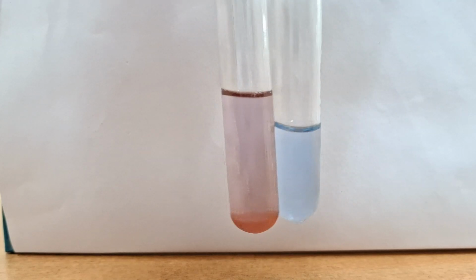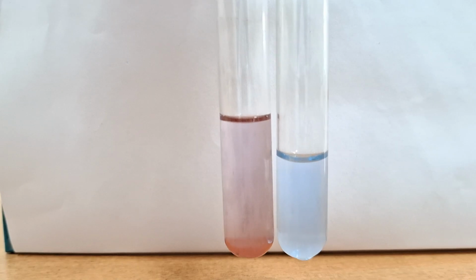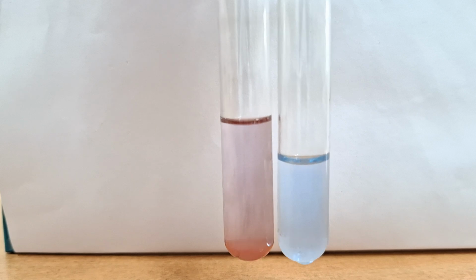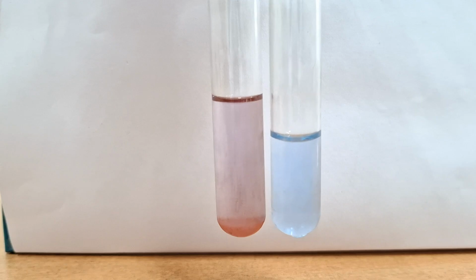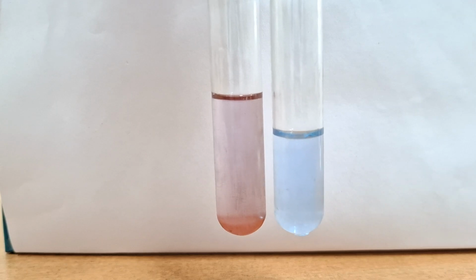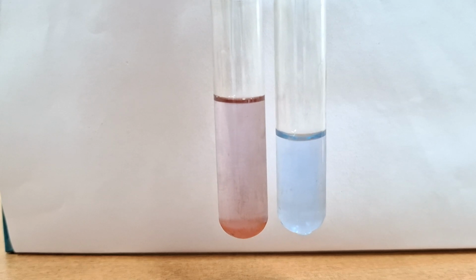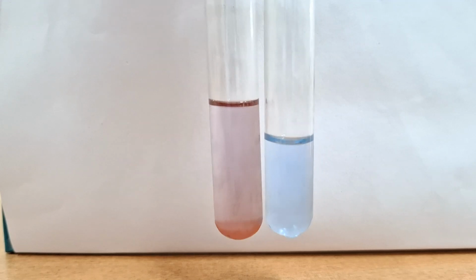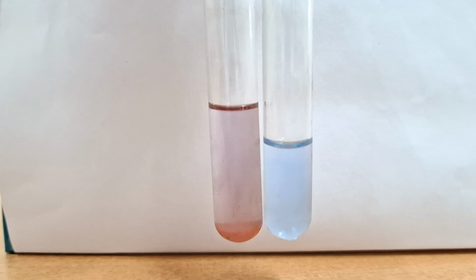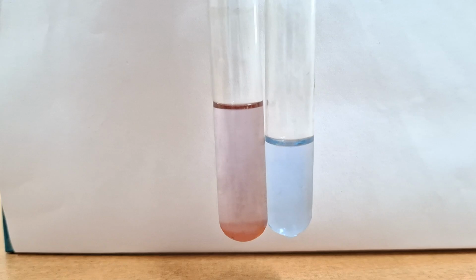Okay, on my left hand side you can see the test is positive, it will yield a violet color, and on the right hand side you can see the test is negative. Because I have added water, and water is protein free. So the left hand side is the test and the right hand side is the control. There is no change in color on the control side. What is the inference? The inference of the biuret test is that 2 or more peptide linkages are present. Okay, so either 2 or more peptide linkages are present, that's why the protein is present.